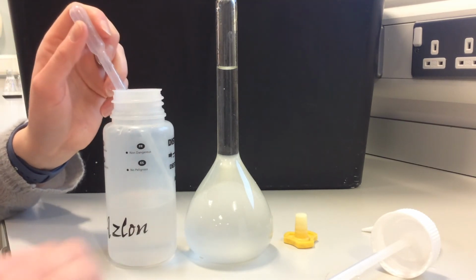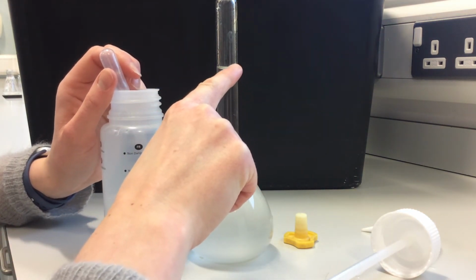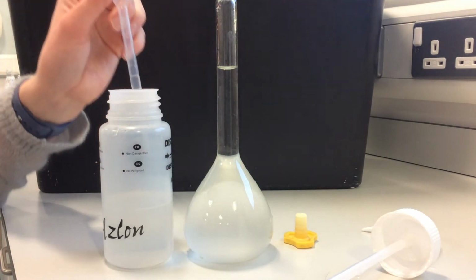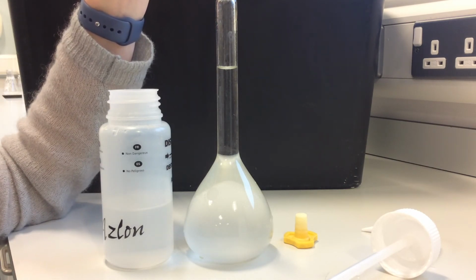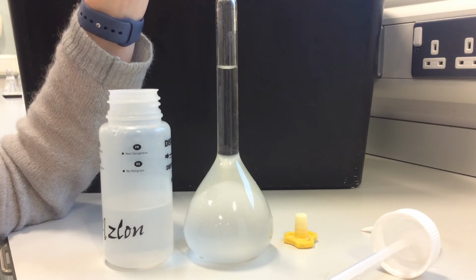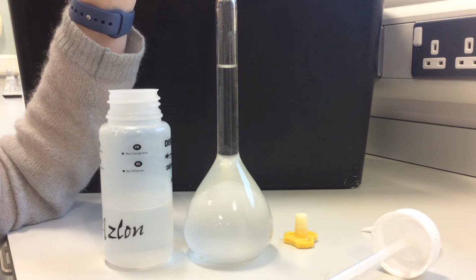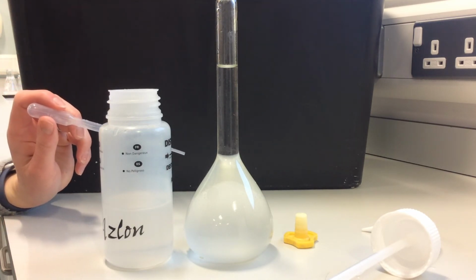We're not far off. Again, not sure what you can see in the video, but if we were to look at the top of the curve, the top of the meniscus, it's sitting on our line now, but we want the bottom of the meniscus to be sitting on the line. So we're just a drop or two away now. I know this probably seems quite tedious, but if we're going to do our calculations at the end of this practical, we need to know how much of our solid is in the solution and the volume of it accurately.